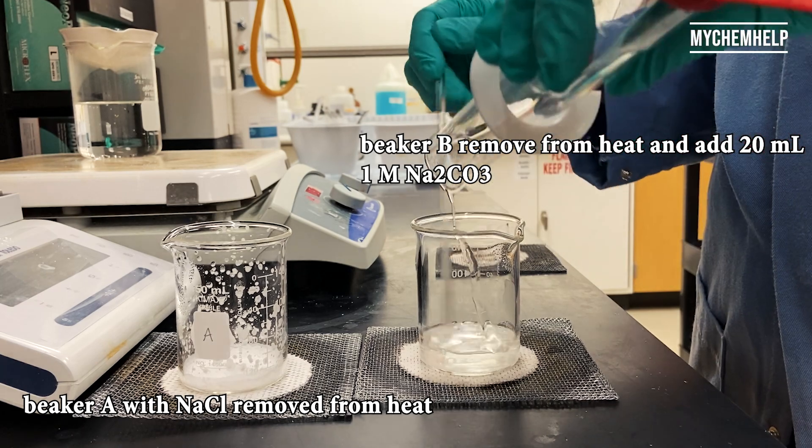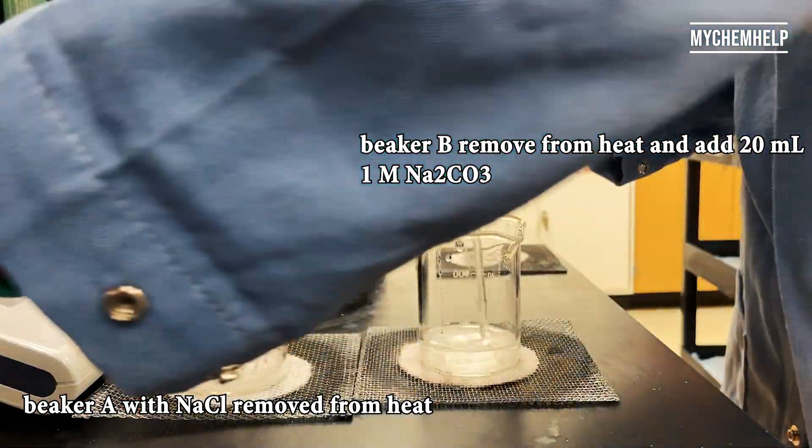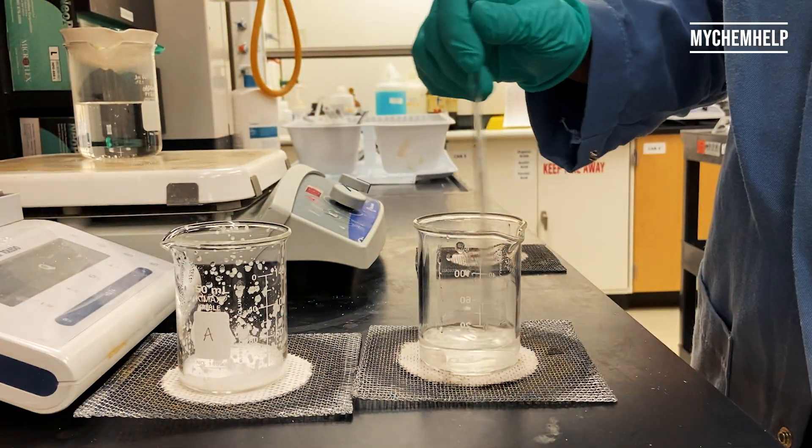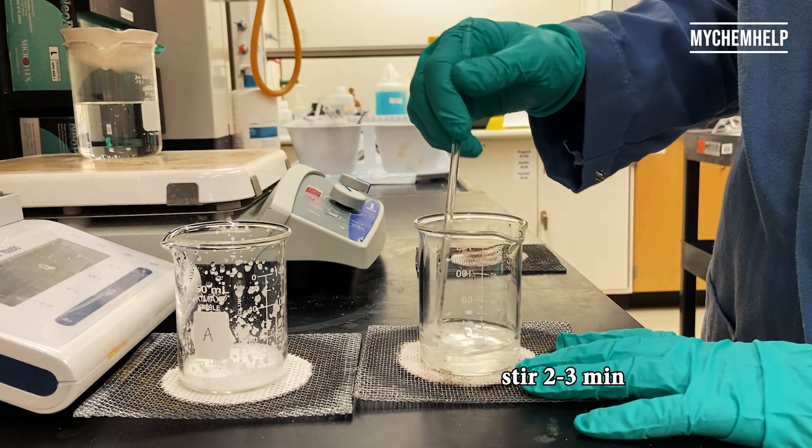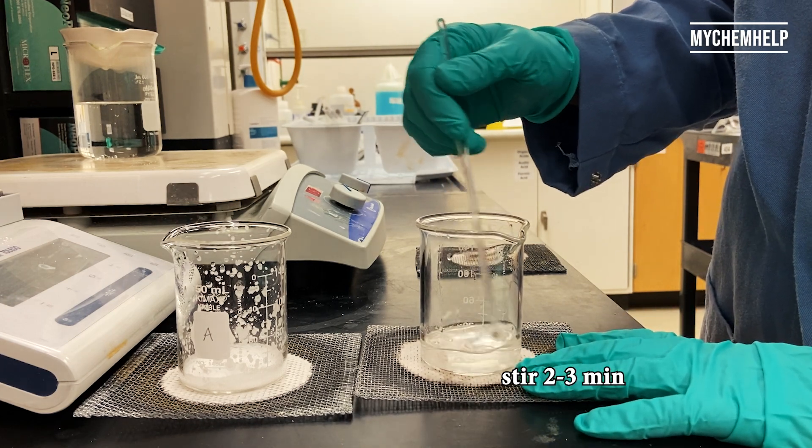And then once I've removed that from the heat, I'm stirring in some sodium carbonate, and I'll be stirring for a couple minutes. This is a good time to think about what reaction is occurring here.